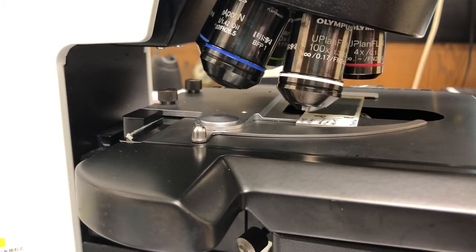Hi, the purpose of this video is to show you how to use oil objectives on the BX61 microscope.